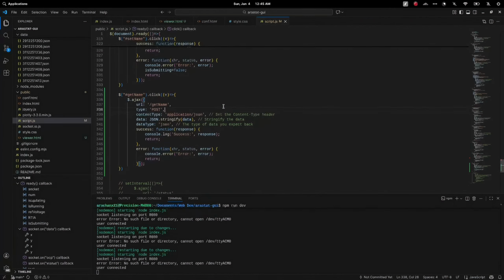But how do we capture the data? Here's how we visualize the data flow. First, the data flows from the microcontroller to our PC through UART. The data is translated from UART to USB packets so that it can be recognized as a local serial port. In the backend server, the incoming data is stored as backups and helps us investigate if there are any anomalies in either our devices or the app.